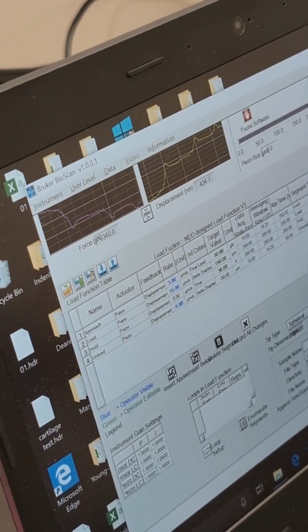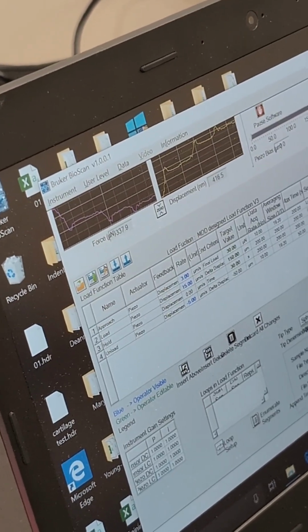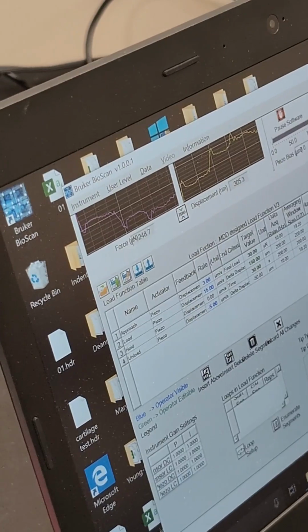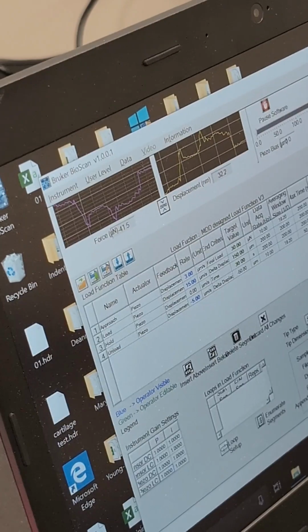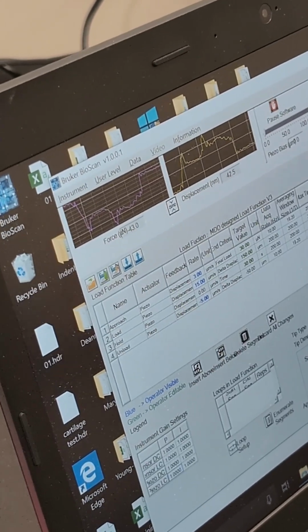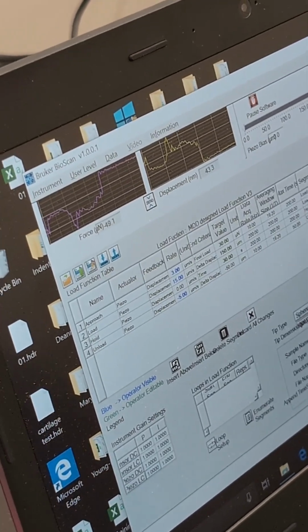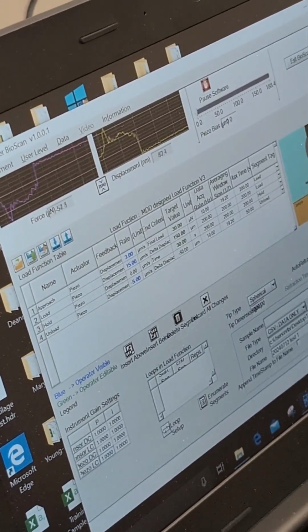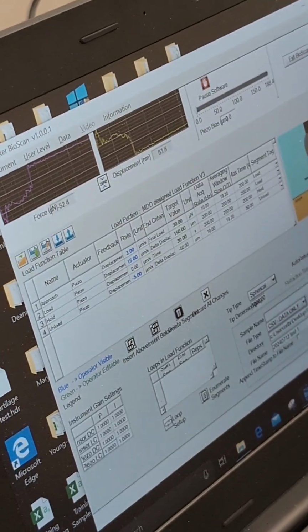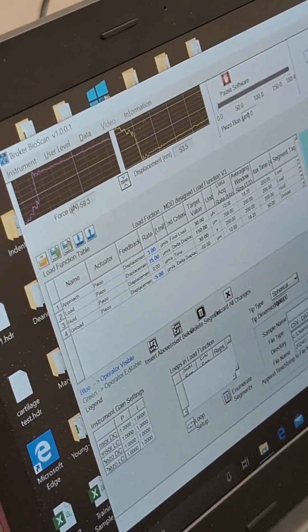Negative 400, so you're going a little bit too much up. So you want to go back down a little bit. Okay, just let it be, let it stabilize. So right now you're looking at roughly like a negative 50 something. I think for today's training purposes, as long as you know where you're trying to hit, we don't have to spend too much time adjusting this exact force.